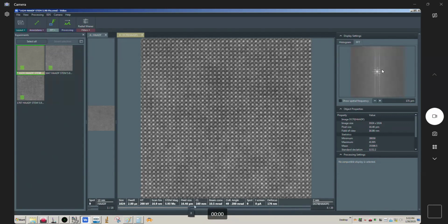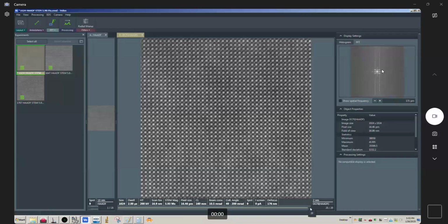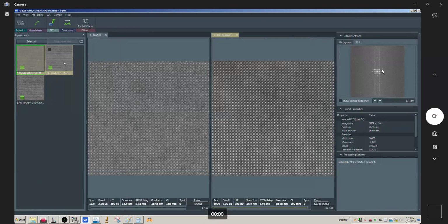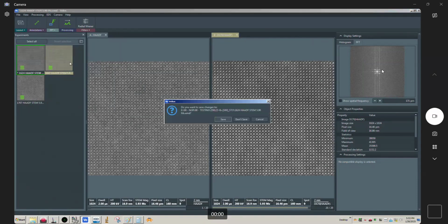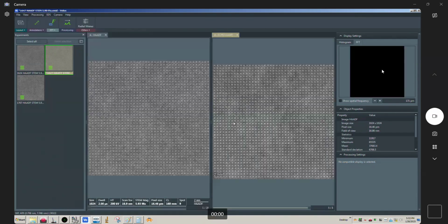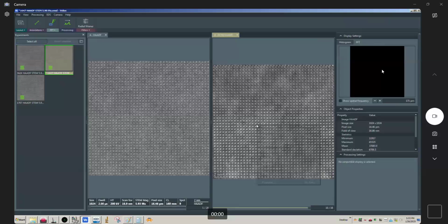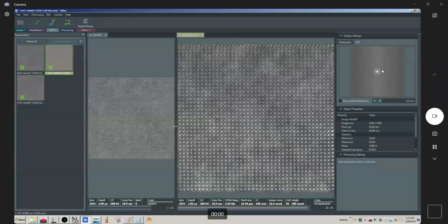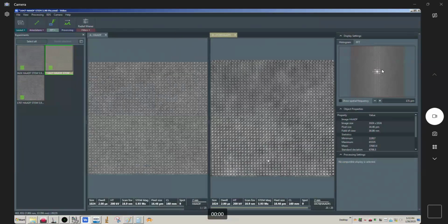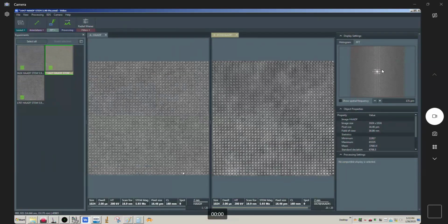This is actually a more mild example of this. I'm going to show you a more severe example of this in the next image. Let me save this, okay? So this is also same resolution, same dwell time per frame, and take a look at this, okay? And that's even worse, right? You can see up here how much smearing we're getting, okay? And it doesn't really look terribly good down here either, okay?